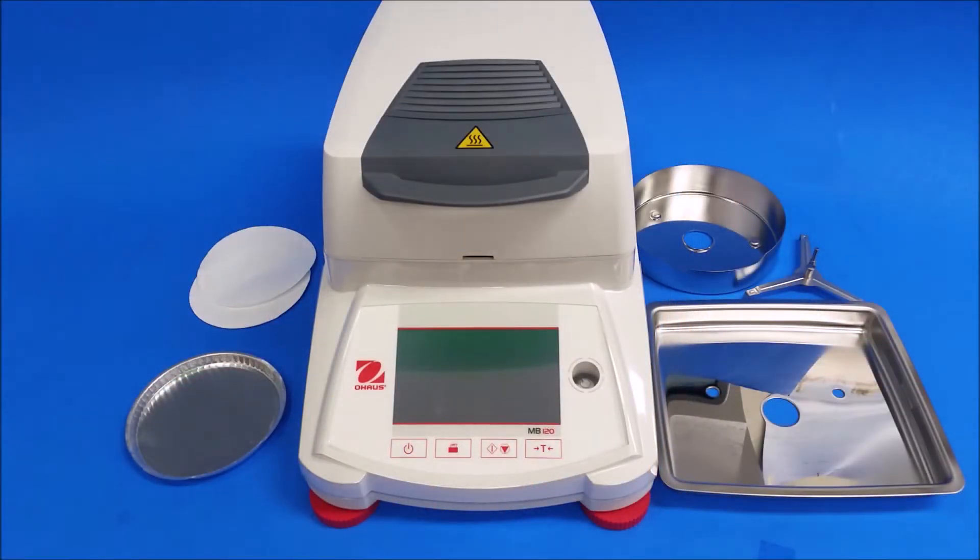Hello, DSCGuy here today. Today I'm going to help you how to run a test on your Ohaus MB120.